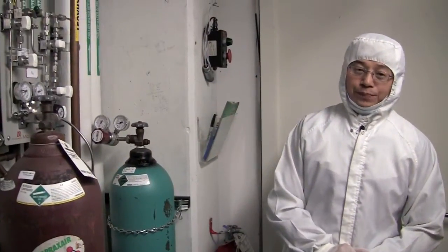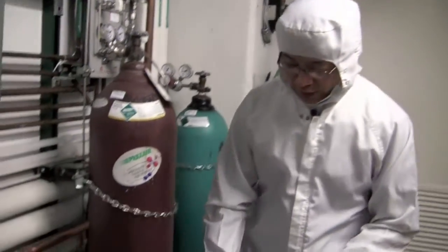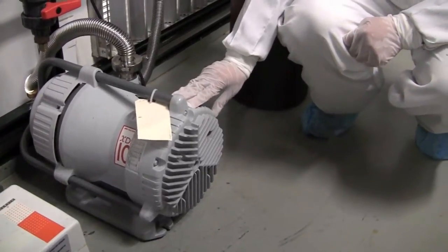Now we are in the chase room. In the chase room, we should make sure two things. First, touch this pump. You should feel the pump is warm and vibrating. That means this is working fine.